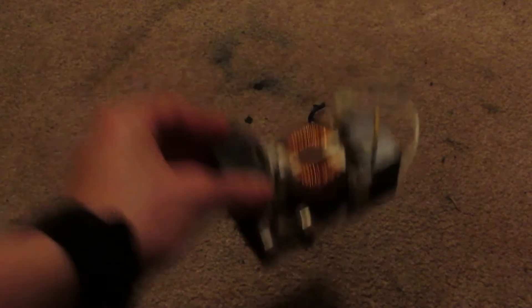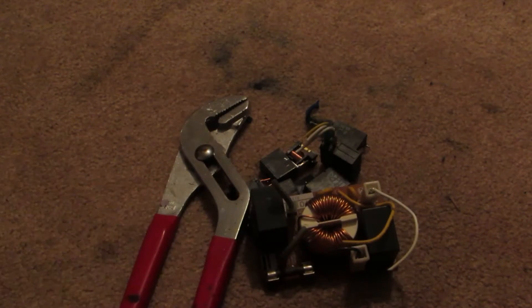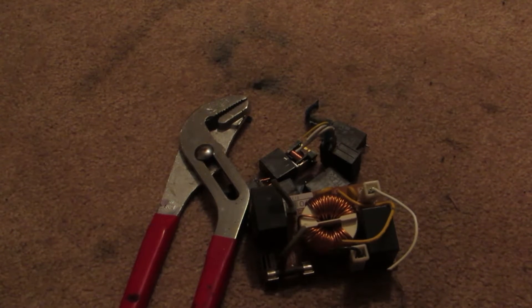So you're just going to rip those off with a pair of pliers or whatever you might have. And then we're going to open them up and see what's inside. I'll be back when I've done that with a bunch of them.